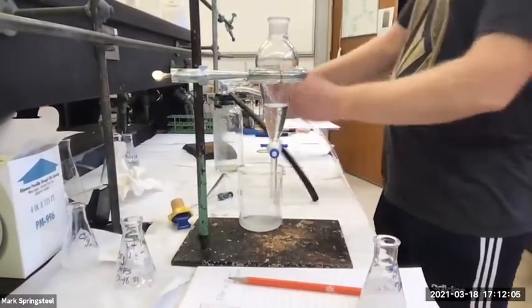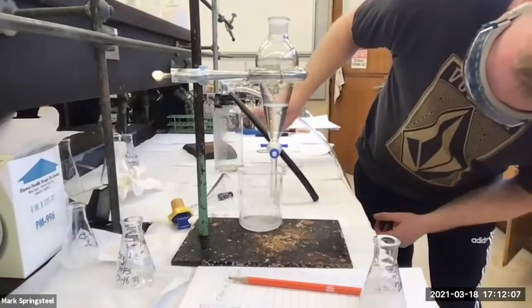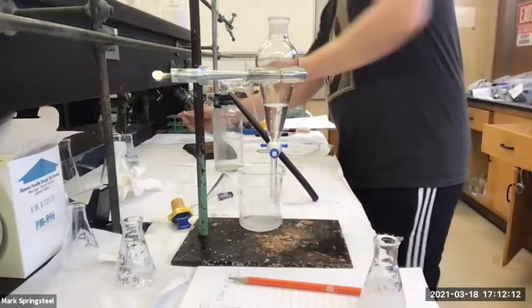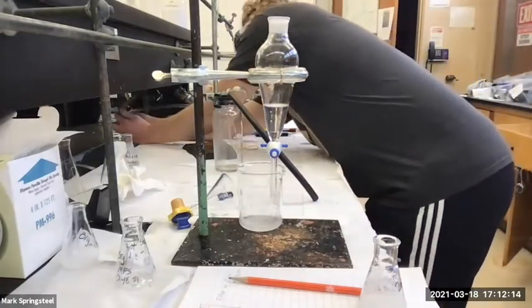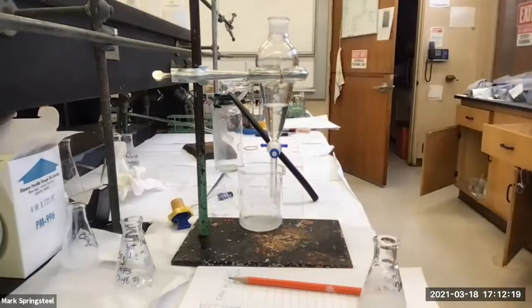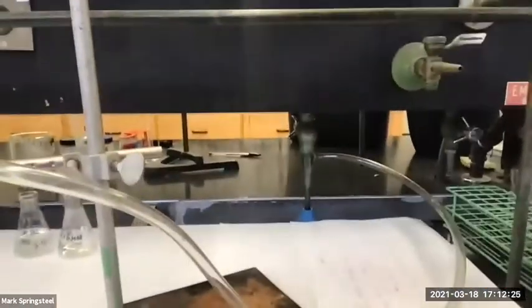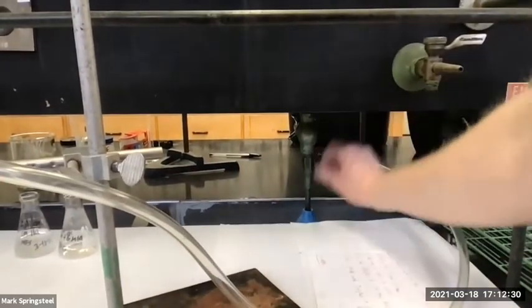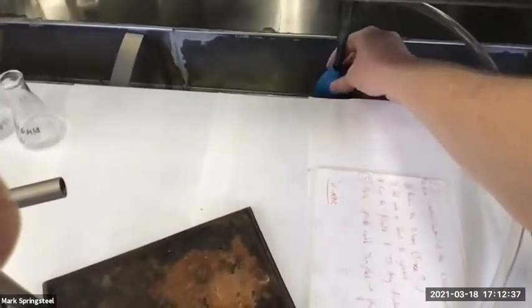When I'm looking inside of here, the longer glass tube will get hooked up to our water aspirator. I'm going to push it on there, then I'll bring the laptop over for you guys to see it. Just a second. So here we are. I just hooked it up to the water aspirator. Yeah, so there's a side arm right here. And the bottom of the water aspirator has a splash guard. Can you guys see this blue splash guard right here?